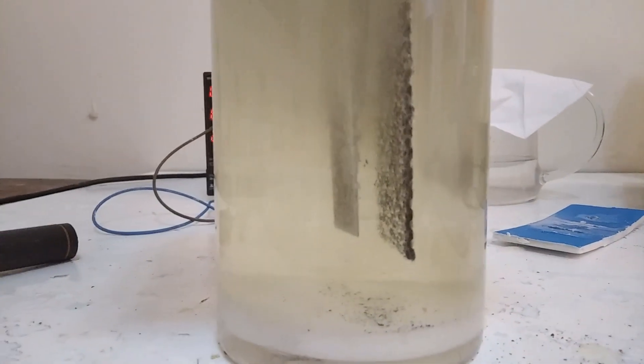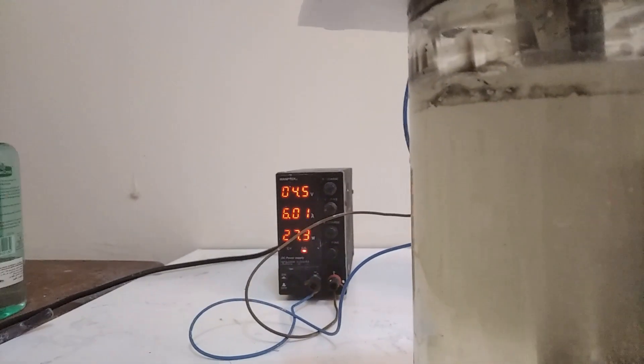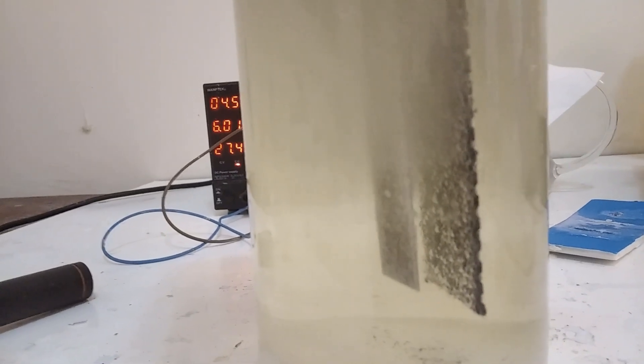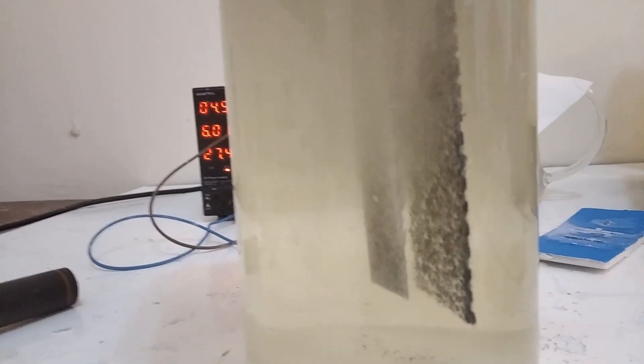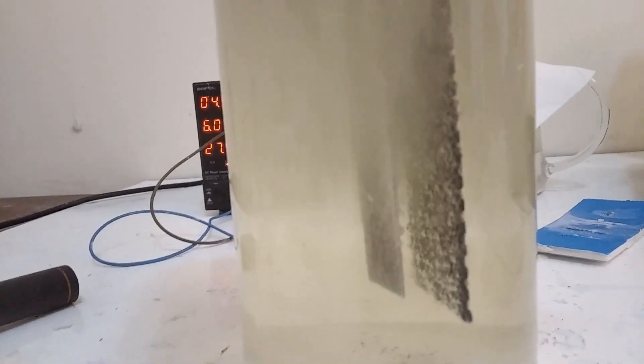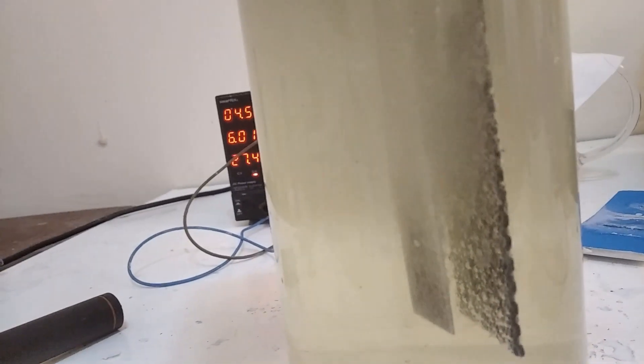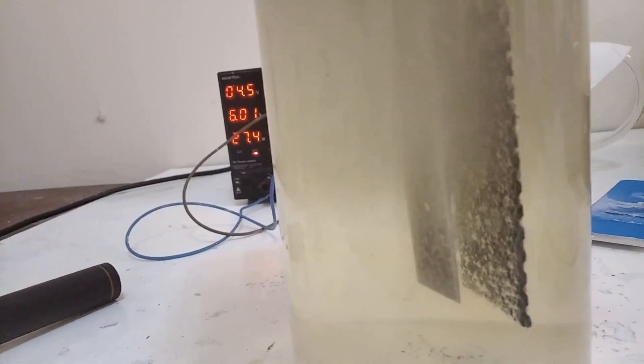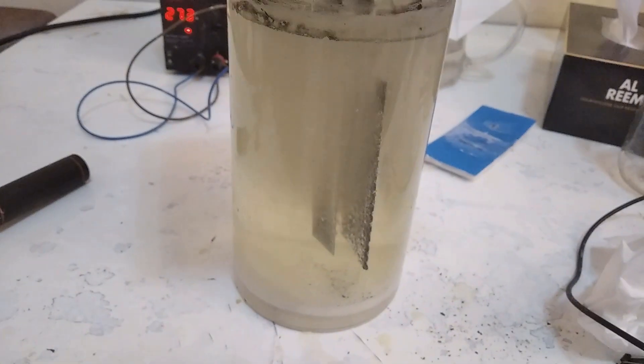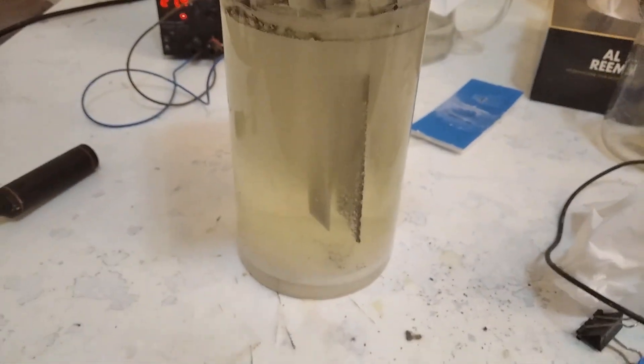I'm gonna probably swap this power supply with a beefier one, or I might keep it because I'll be honest, this is just a test. Then again, I don't want to run six amps. I can tell this thing is destined to run like 30 or 20. This is my crappier electrode by the way, the one where I didn't even think it was gonna work. You know what, I'm gonna swap the electrodes. I'm gonna run at high amps.